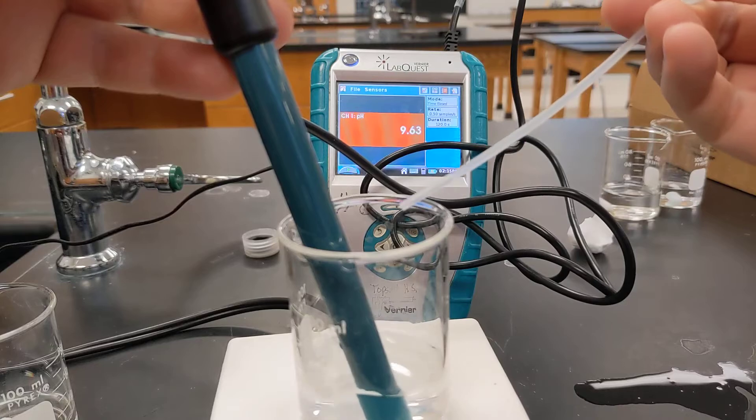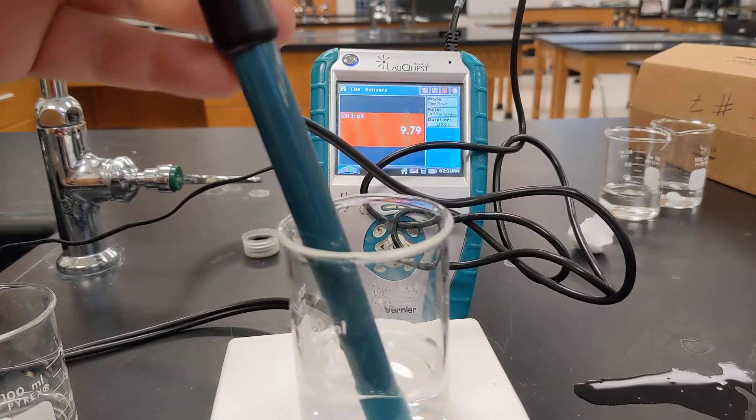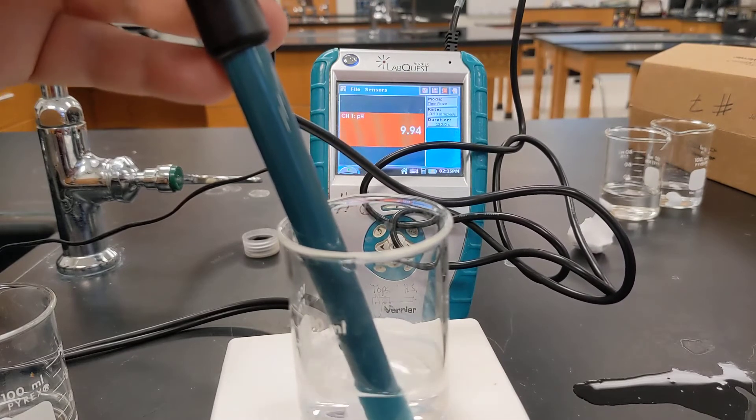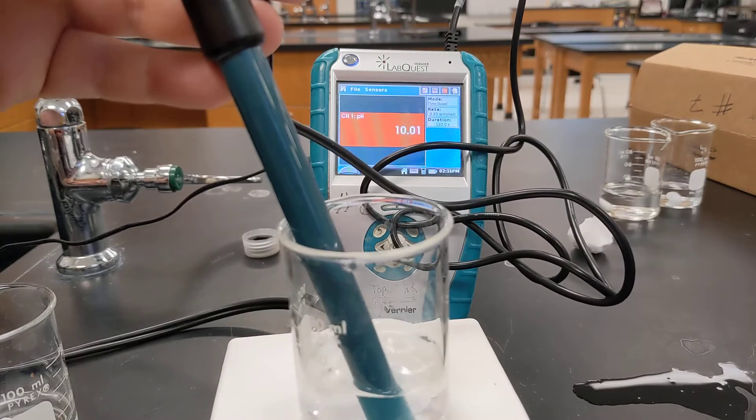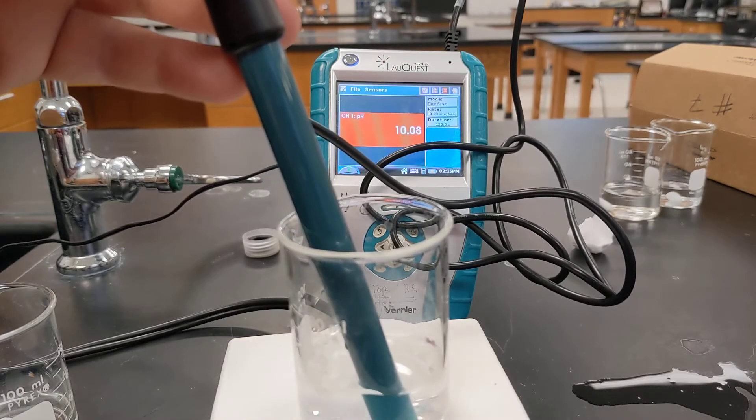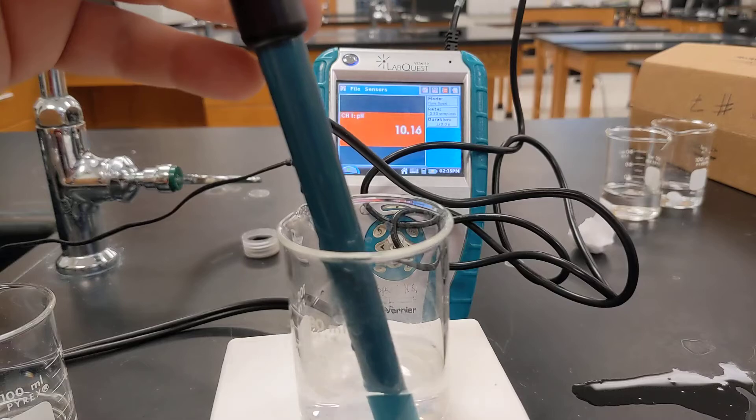A fifth drop, and you can see we've had a very dramatic change in pH there, just with five drops.